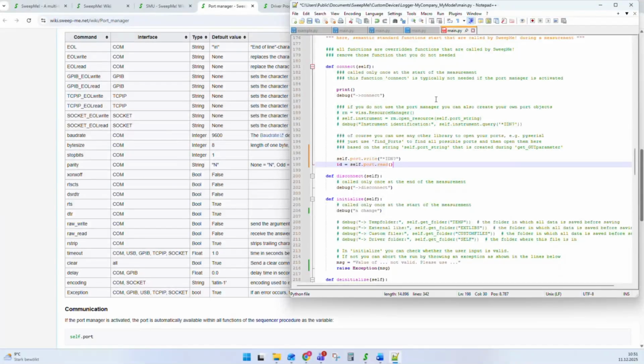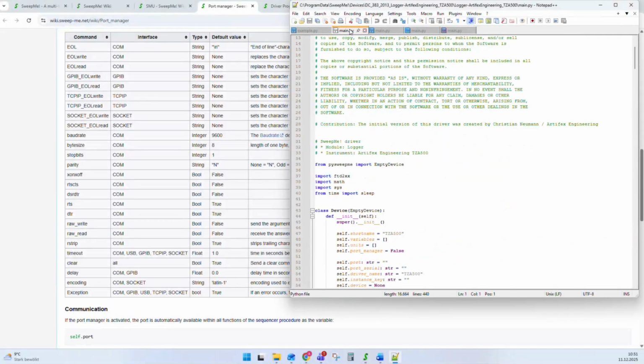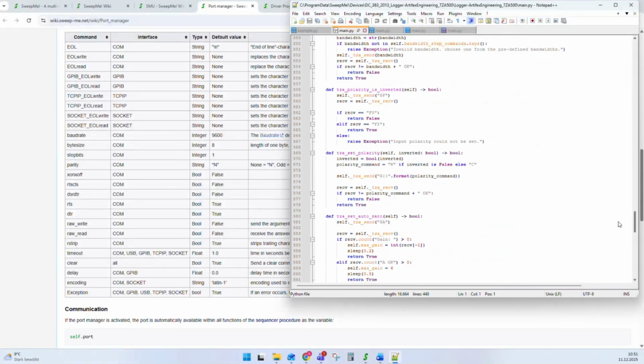Okay. And we have also some wrapped communication commands that I want to speak about as a next thing. Let me check whether I find a good example driver for this. Yeah, this is also a good driver.